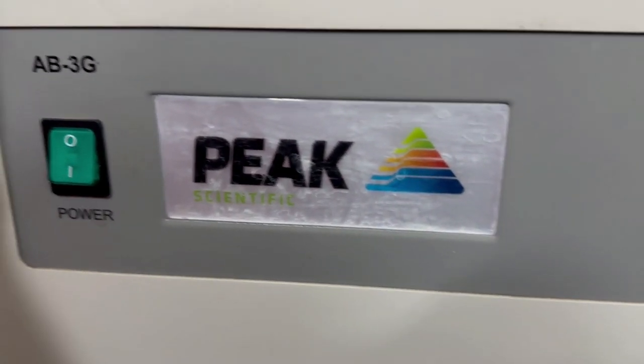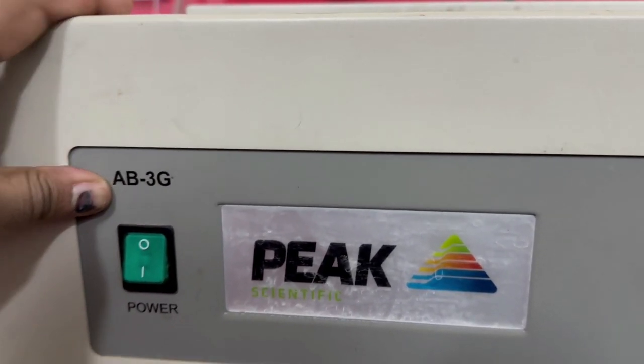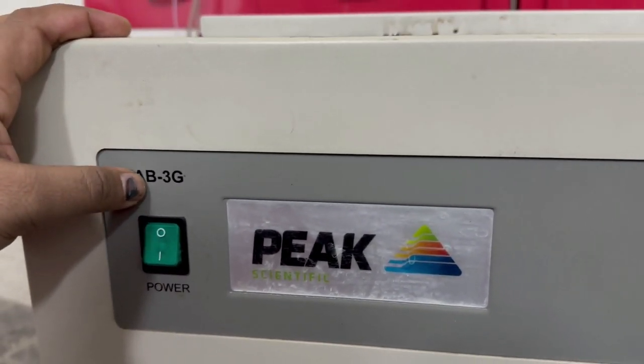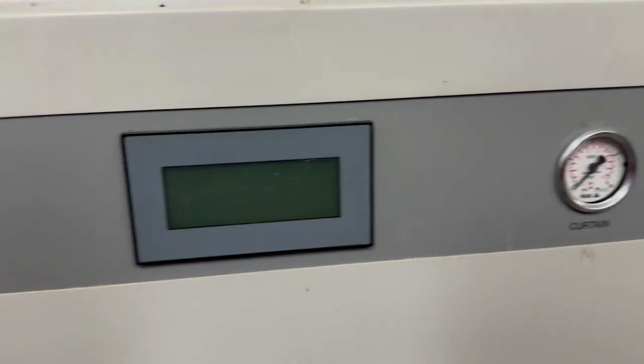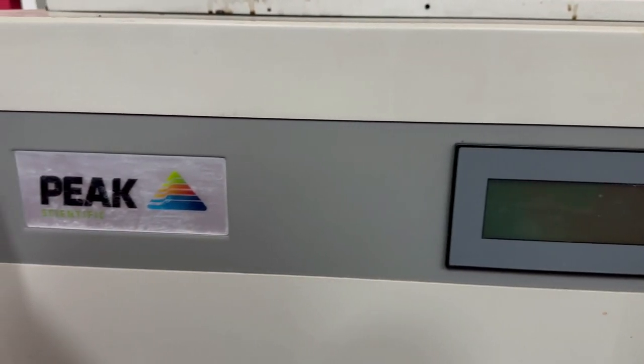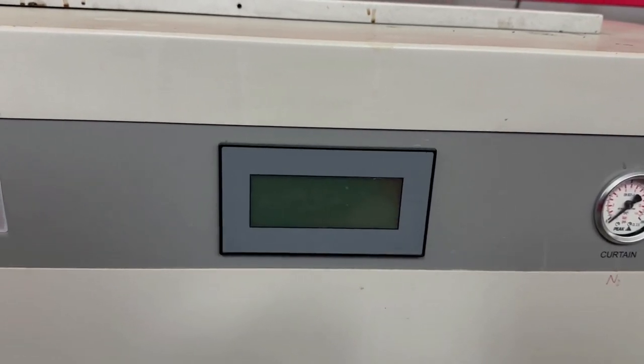So guys, today we have to diagnose this problem and troubleshoot this. This is AB3G by Peak Scientific and it's a nitrogen generator. The problem is, once we start it up, it gives us some error. So we have to fix this.